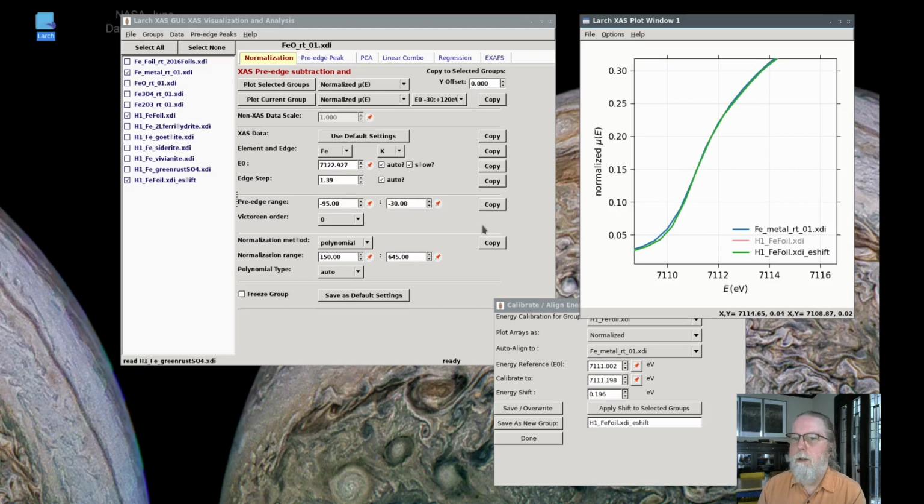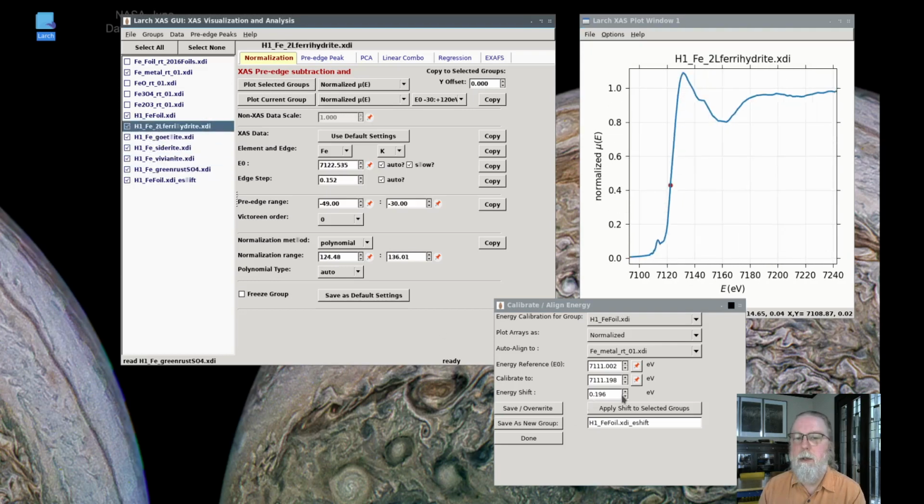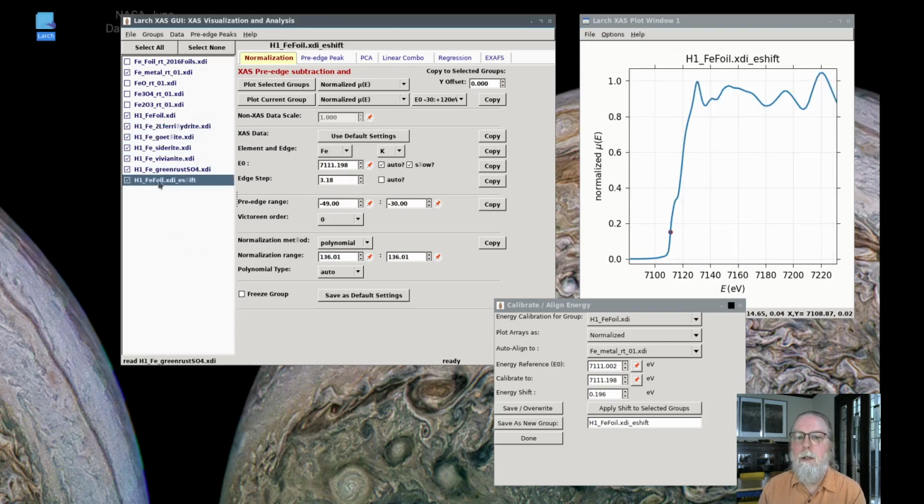But what I would really want to do is then take all of these other spectra that were measured at the same time and apply that same shift of 0.2 eV to those. So in fact, I'll go here and take this shifted one and select none and take this one and remove that from the list, and take all of these and select all below. So all of those H1 sets of data are now selected, and now I can say apply this shift of 0.2 eV effectively to all of the data sets, and that will overwrite those sets of data. It will shift the energy for all of those.